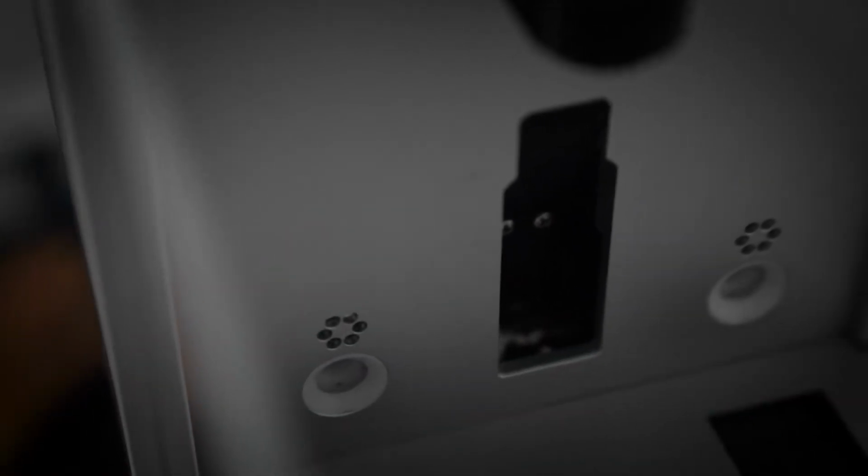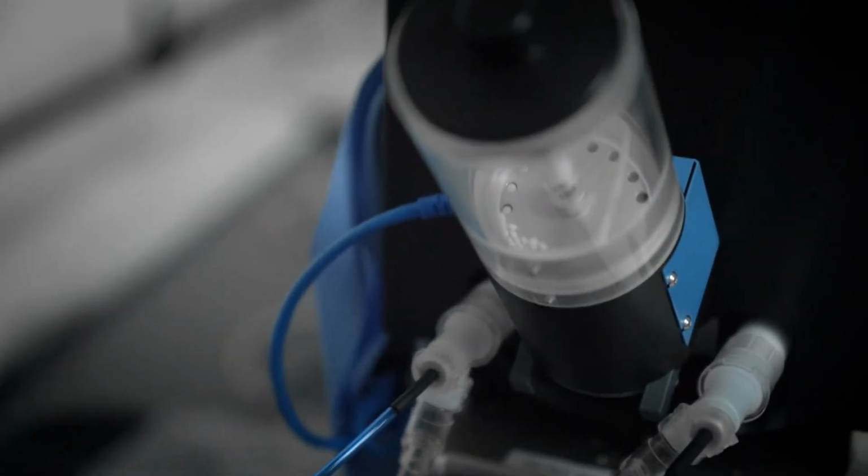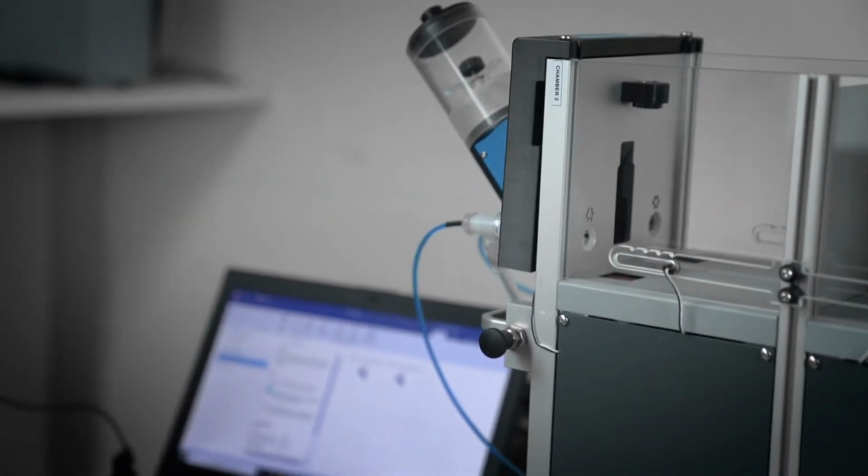So basically, every time the animal has done what it has to do and the test is accomplished, a pellet will be dispensed. Consider that these pellet dispensers are quite sophisticated because there is a system to check if the pellet has really been dispensed, and if not, the pellet keeps rotating until it really happens. It's not just a motor that relies on the fact that the pellet goes down. There is an internal system that checks whether the pellet is being dispensed or not.